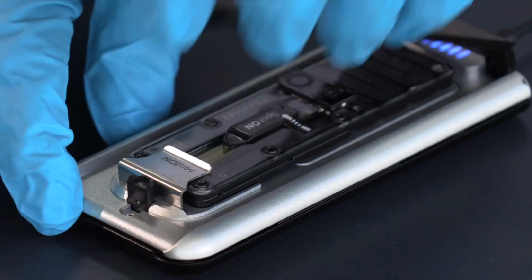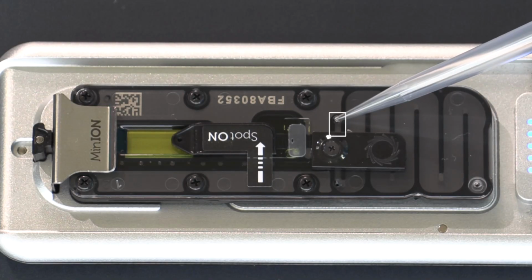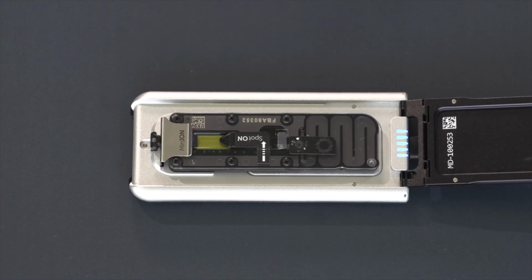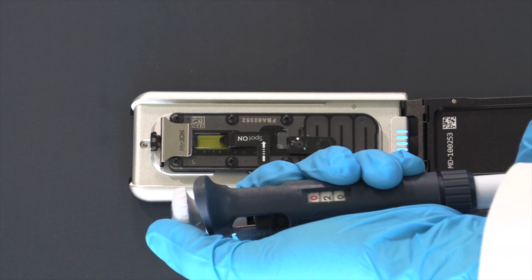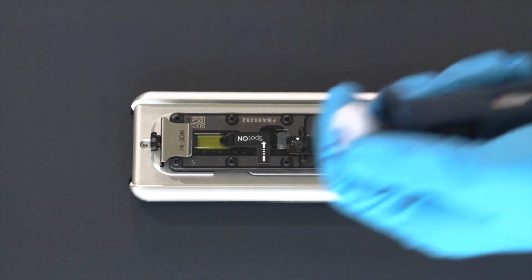In order to prime a MinION Flow Cell, first, open the priming port cover. You will see that this area here is of a lighter color than the rest of the channel. This is because of an air pocket that needs to be removed before the flush. To remove this air pocket, use a P1000 pipette to withdraw a few microliters of buffer by either raising the plunger gently or twisting the plunger like so.